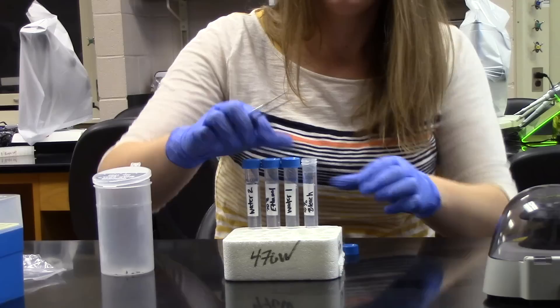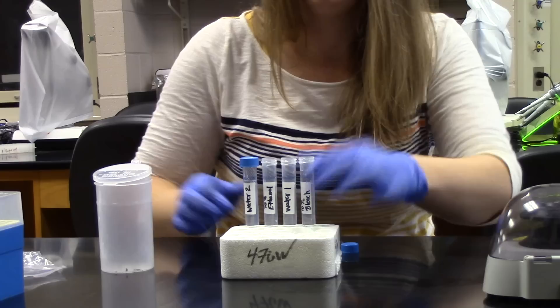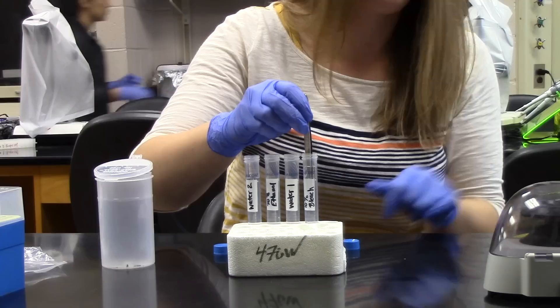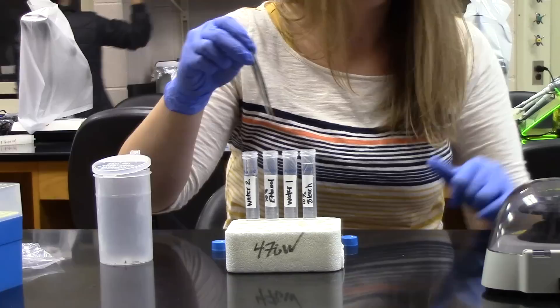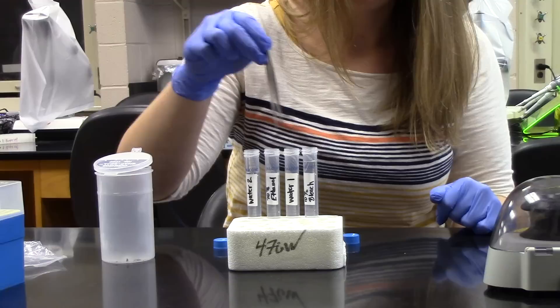And the process begins with bleach for 3 seconds. And it will be good to have someone in your lab group timing this. And then move on to the water wash for 10 seconds. And then on to the ethanol for 5 seconds. And the final water wash for another 10 seconds.